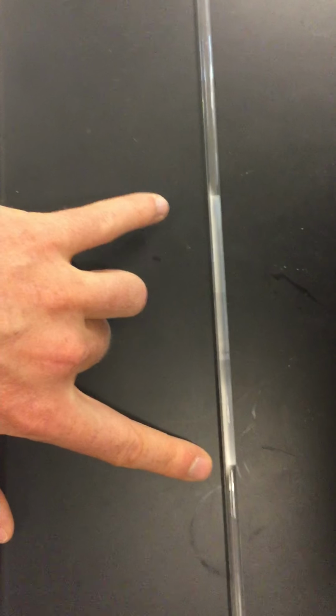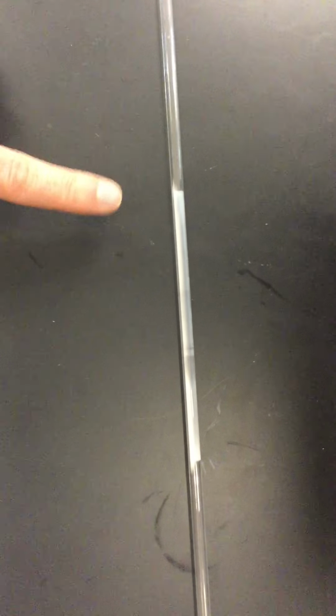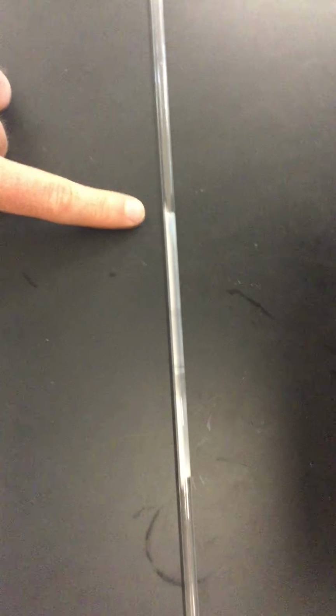And the place that they meet, you'll notice we get this white kind of mark on the tube. Now I've let this sit for a while, so the white actually stretches for a fair distance, like the white stretching that entire part of the tube. But the place where it first met, when I first saw the white mark form, is right there. So that tells us how far these gases have traveled from either side before they met and formed this reaction with a white precipitate.